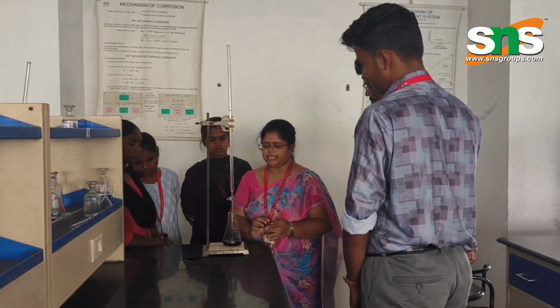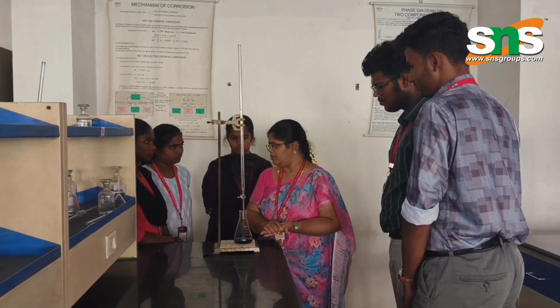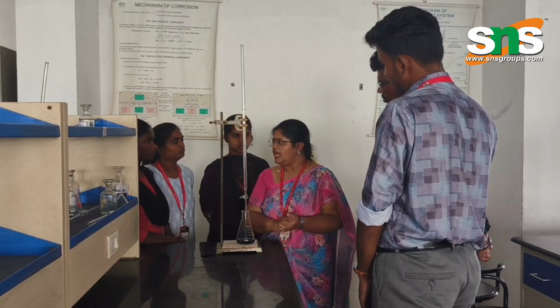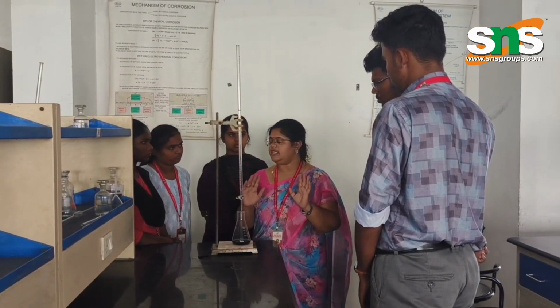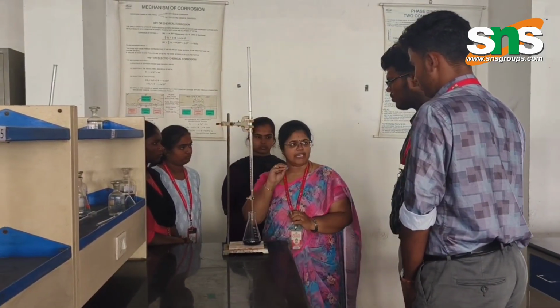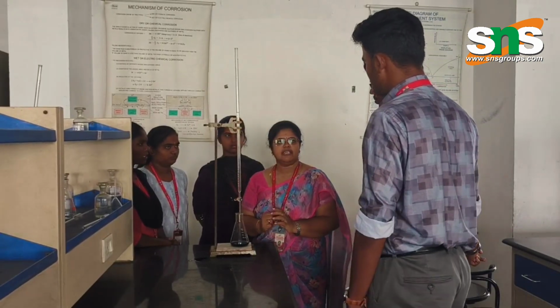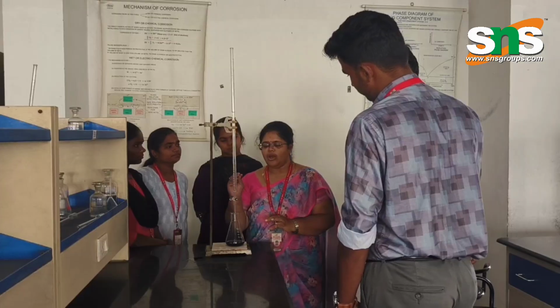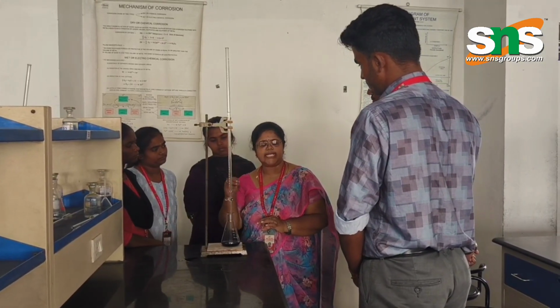Here I am getting the steel blue color. That is the end point. So you have the steel blue color as the end point. Now what does it mean? First I got the wine red color. Why does the wine red color occur? What is the chemical that causes hardness in water? Any idea? Calcium and magnesium. Okay, calcium and magnesium.